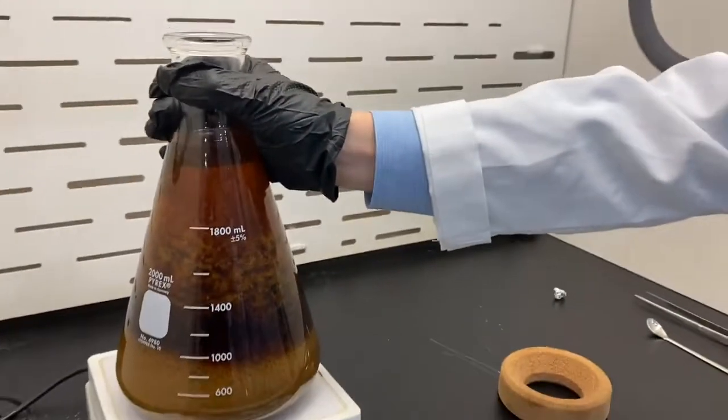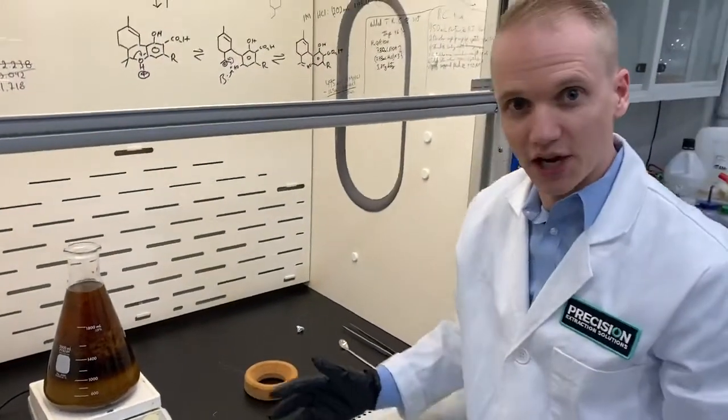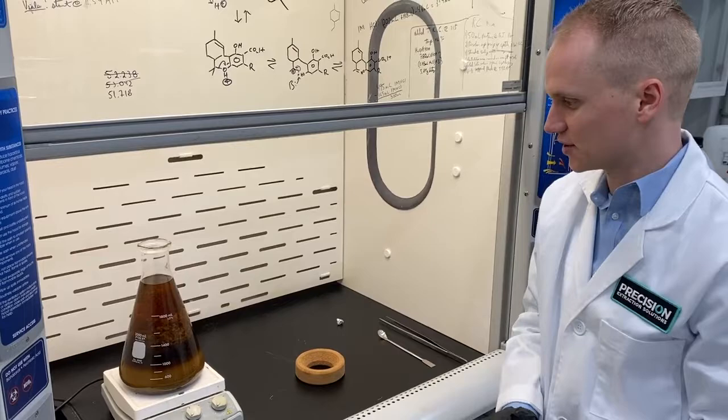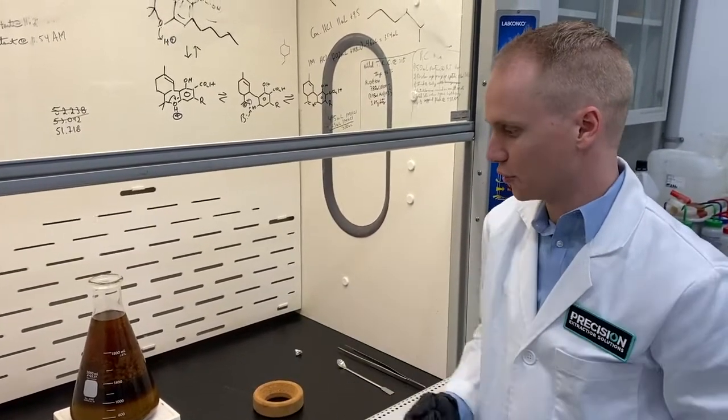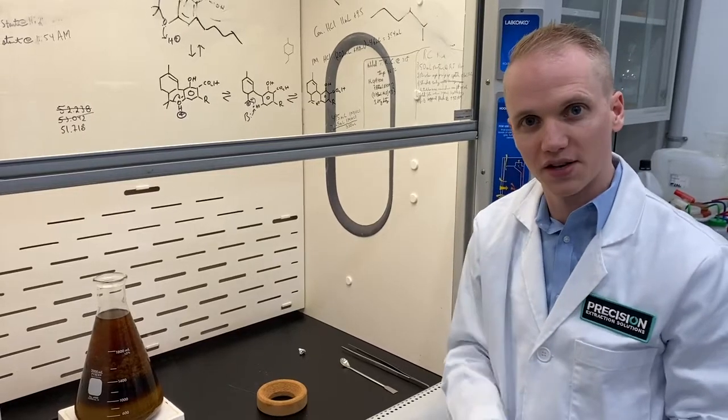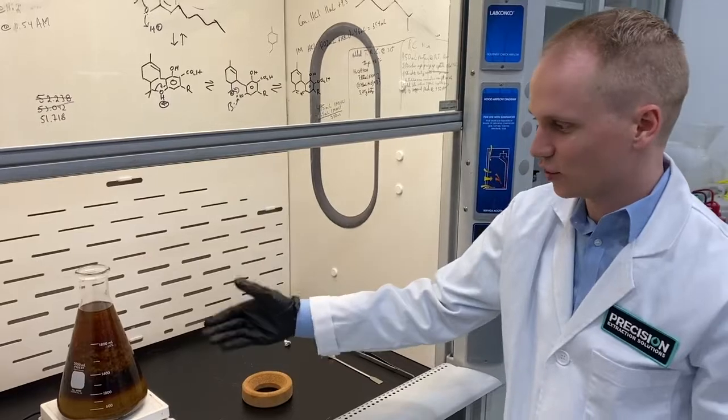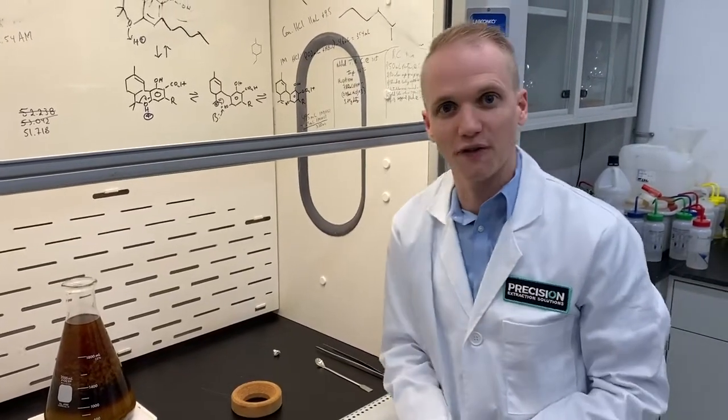So now that's ready to be filtered. That's an instantaneous crystallization of the lipids. This can then be poured through any sort of filtration system, whether you're doing a small batch like this on lab scale and throw it through a Buechner, or you have a larger filter press. Whatever the circumstance, it very drastically crystallizes the lipids within solution, and it's ready to be filtered very quickly.